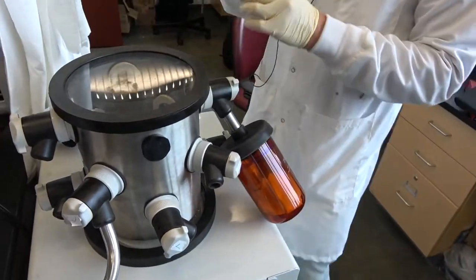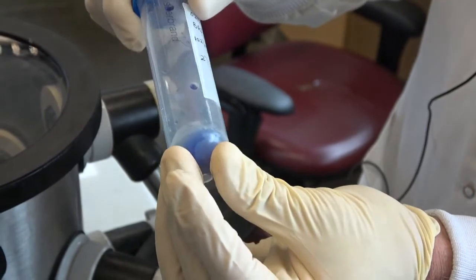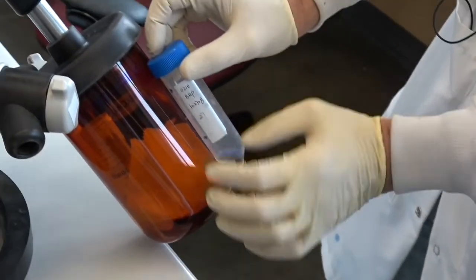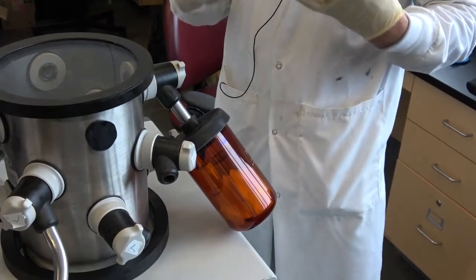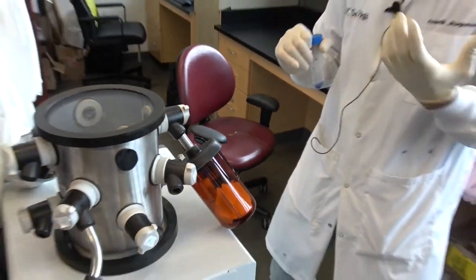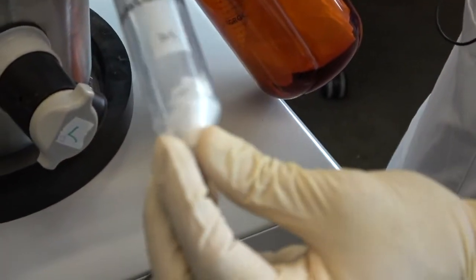So what you would have done if you were here is you would have first redissolved your particles into a solvent after washing them a couple times, and you would have froze it, okay? Then, while it's still frozen, you would put it inside of one of these little chambers and turn on the vacuum in order to pull negative pressure. So you're basically putting ice in a vacuum. And what happens is the solvent sublimates, and it's kind of magic because what you're left with is this really fine, beautiful powder.